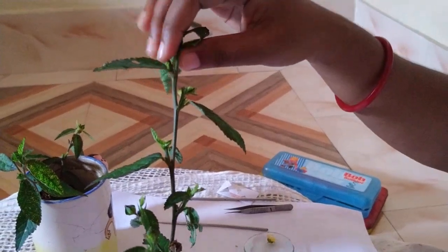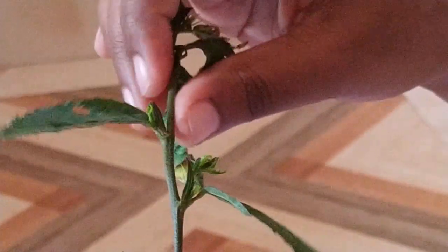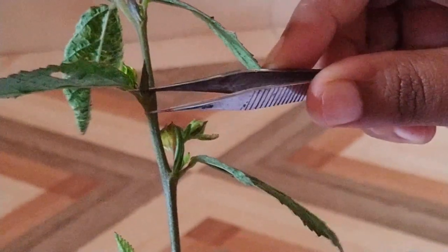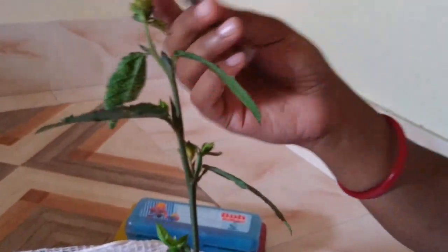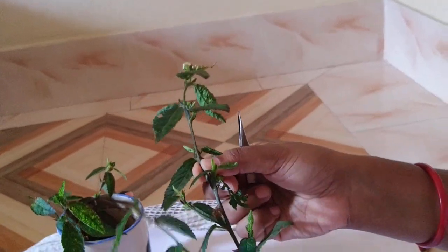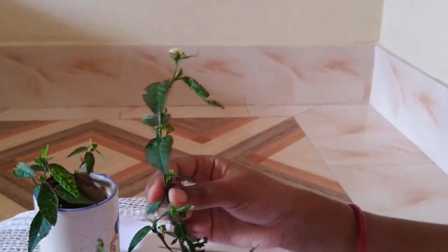One important thing found here is the Stipule. Stipule is present there. In the young portion, there are some small hairs present. And the cut or wounded portion of the plant body secretes some mucilaginous substance. That is also a diagnostic character of the Malvaceae family.